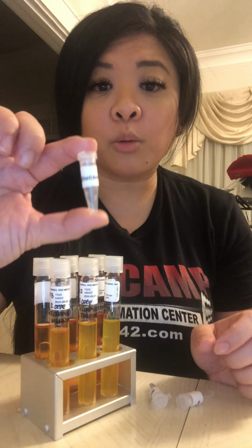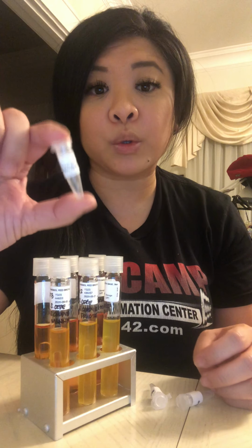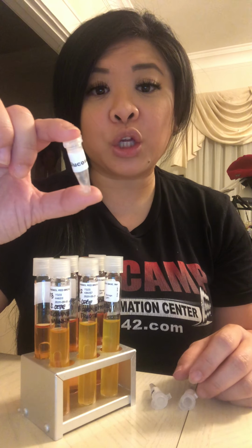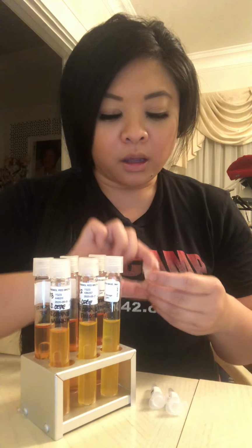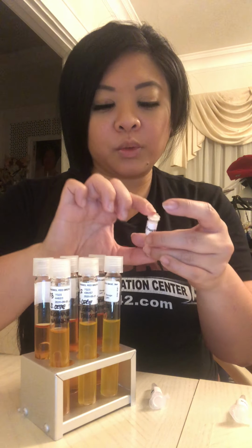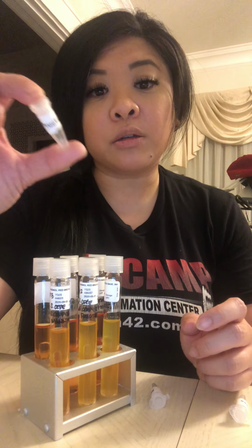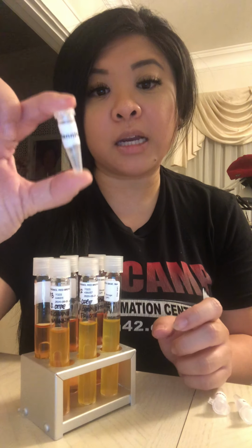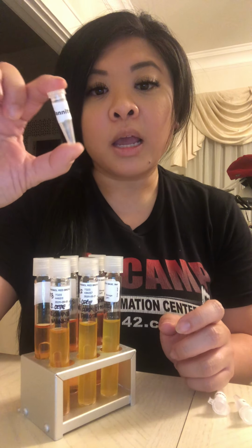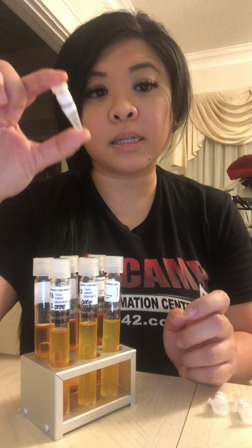Glucose is a carbohydrate that is produced from plants and animals through photosynthesis, as well as humans and their metabolism and glycogen. And then the next one we used was fructose. It's a carbohydrate that is found in fruits and vegetables. And then finally we use mannitol. Mannitol is more of a crystallized alcohol and is produced by plants.